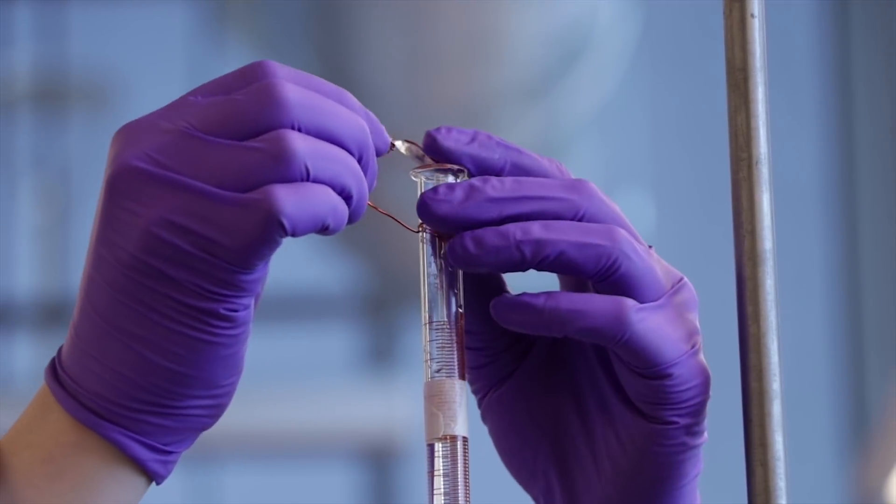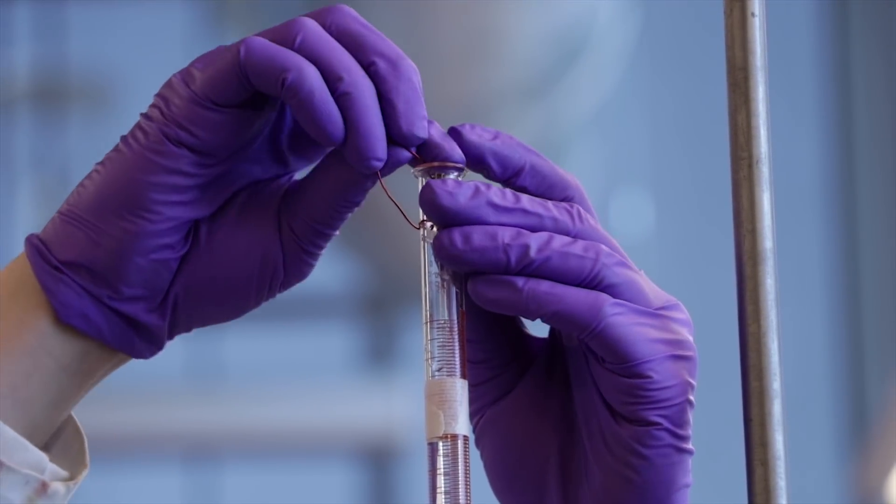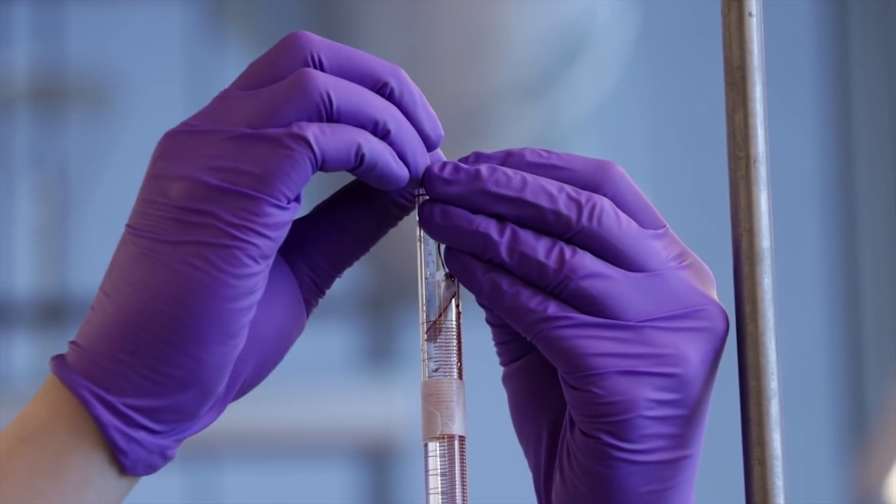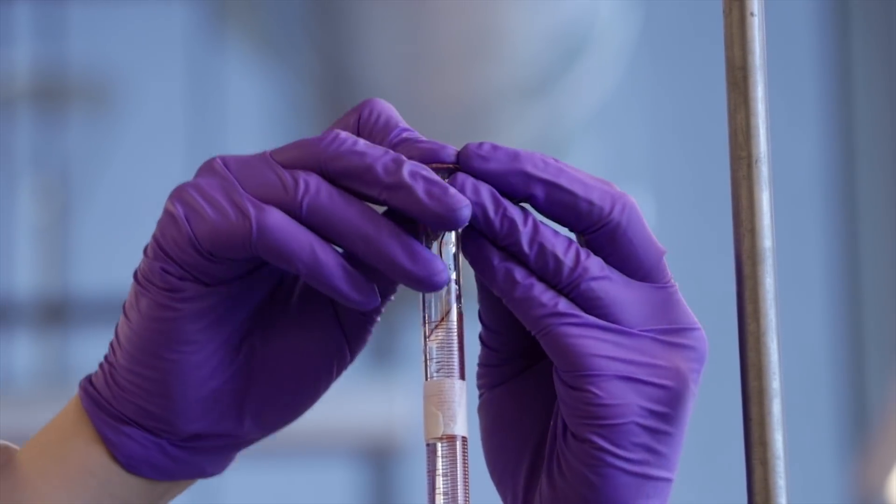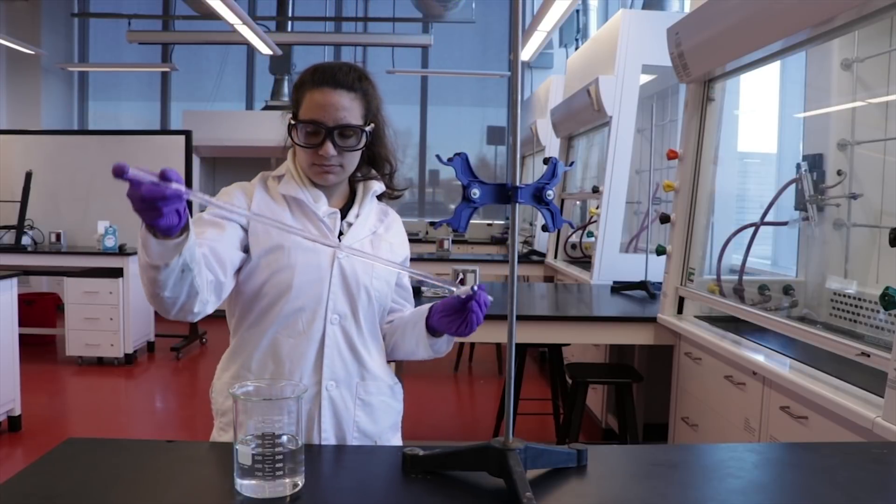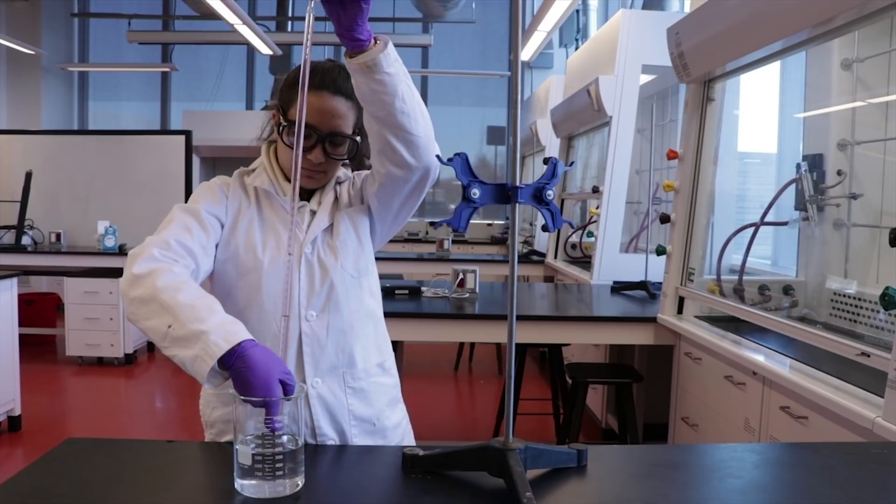Insert the ribbon into the burette so that it sits a few centimeters inside. Carefully cover and invert the burette into a beaker of water and immediately record the initial burette reading.